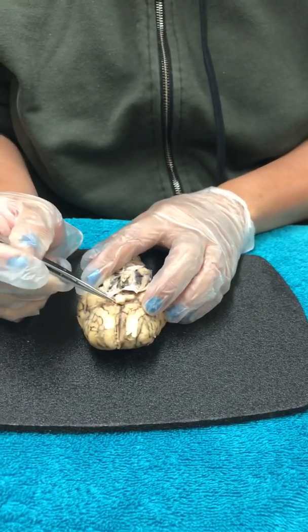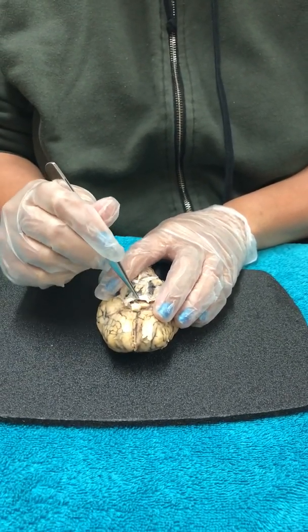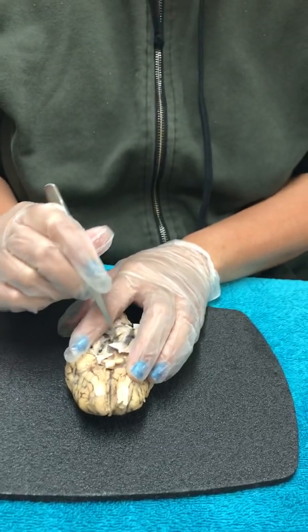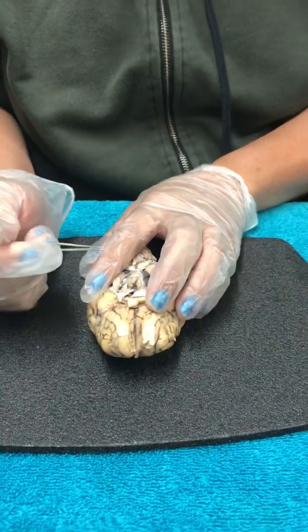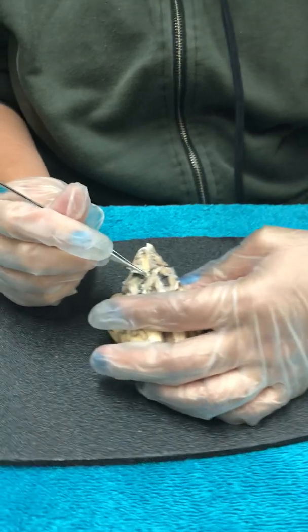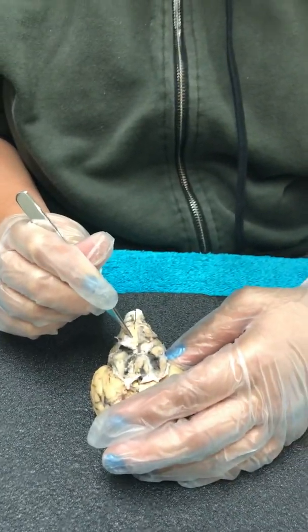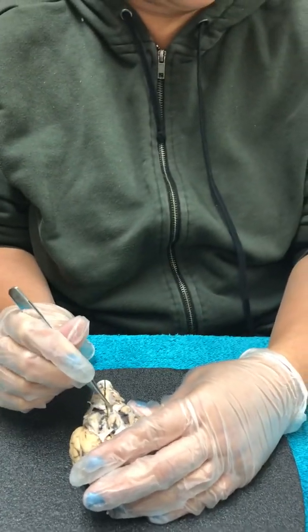As you can see, it got cut off a little bit when I was cutting the layer of the brain. And when it goes down, it's called the optic chiasma. Then crossing like an X, the optic tract. And it goes through to the occipital lobe. When you go down in this area, this is the pituitary gland, and in the middle of the brain is where the pons is at. The pons is right here.